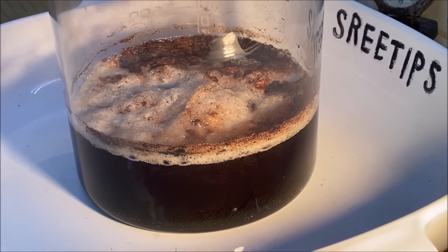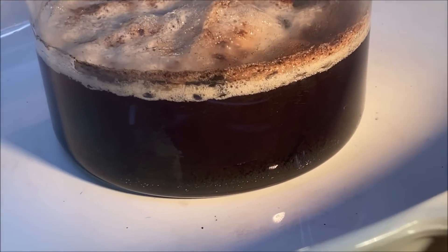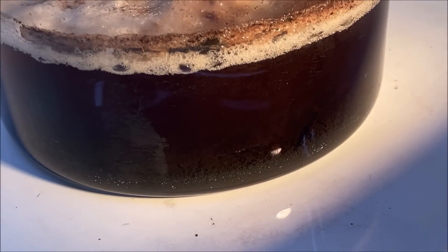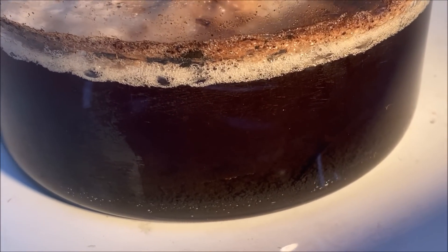Welcome back to part 3 of the dental scrap recovery refining series of videos. If you look down here you can see that we've got some metal accumulated down on the bottom of this beaker.